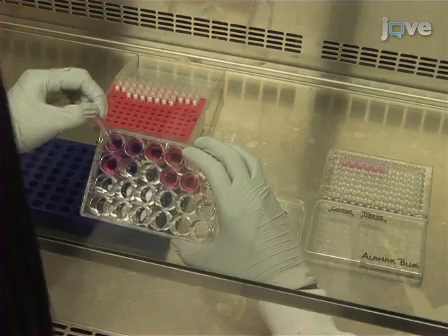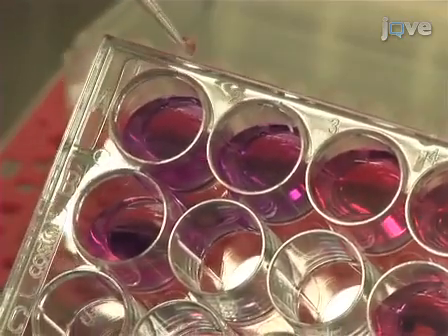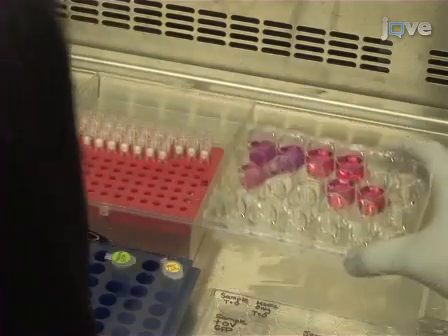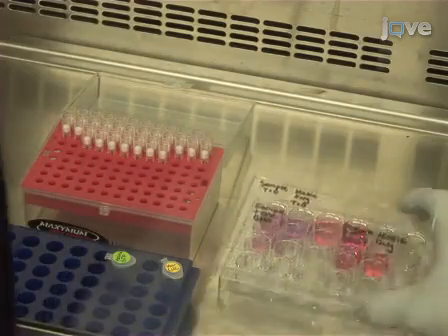Use a pipette tip to transfer each piece of tissue from the Alamar Blue treated wells to a clean, media-containing well of the 24-well plate. Avoid transferring large amounts of media with the sample.